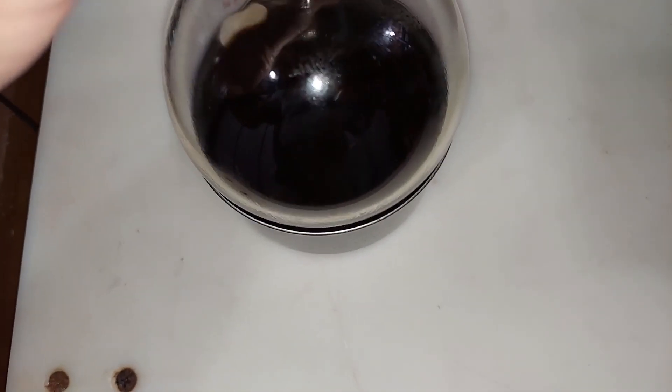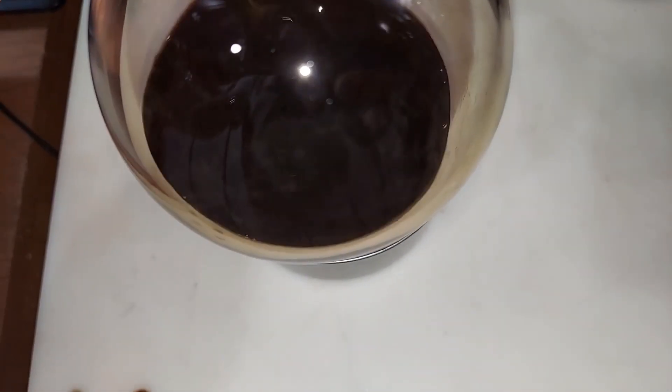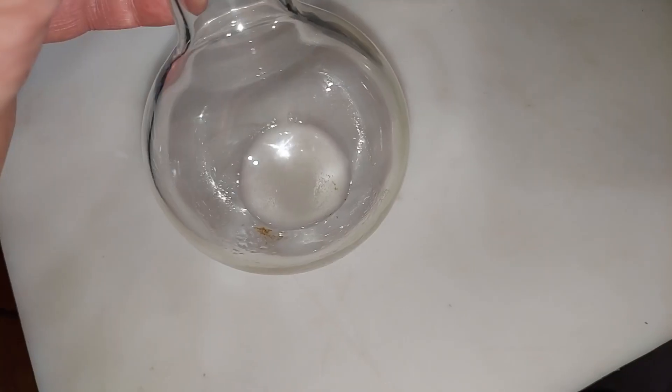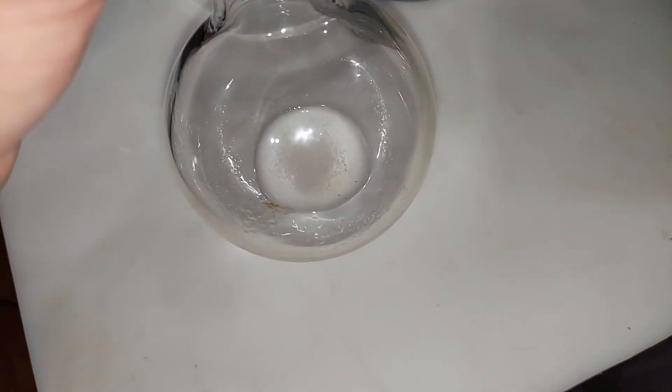The first couple of times I did this, that black tarry stuff was so hard to get off and I eventually used acetone — it worked best and still took some scrubbing. This time I poured the acetone in right away and there's nothing left on the wall. This is our phenol — you can see it's nice and clear, and it's pure enough that it's crystallized on the bottom, which can happen at room temperature. It's about 72 degrees in here right now.